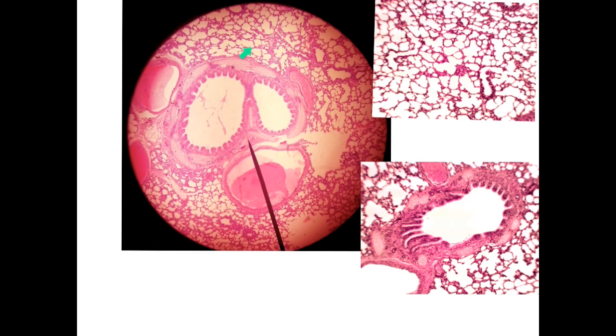This is a slide, of course, it is spongy in appearance, so it is one of these three slides. If you look here, you will notice that it has a bronchus due to the presence of this cartilage here. And of course, this is a large blood vessel. Here you can see also this is a bronchus, and these are the alveoli. It may show only bronchioles like this also, not necessary to show the bronchi, but the presence of these empty alveoli with the bronchioles and blood vessels, which are very big, demonstrates the lung tissue.